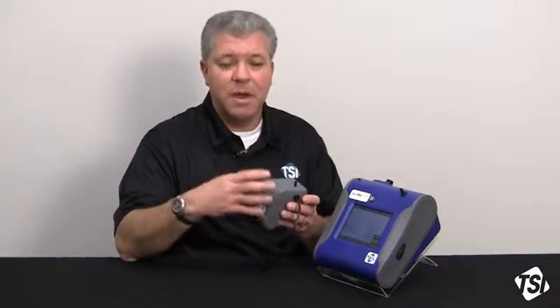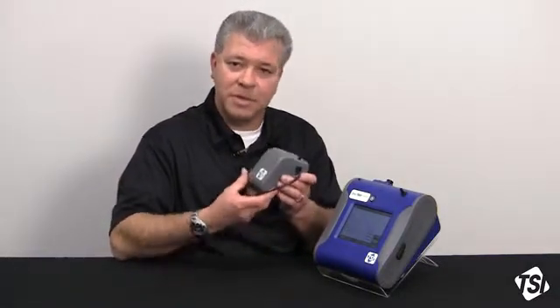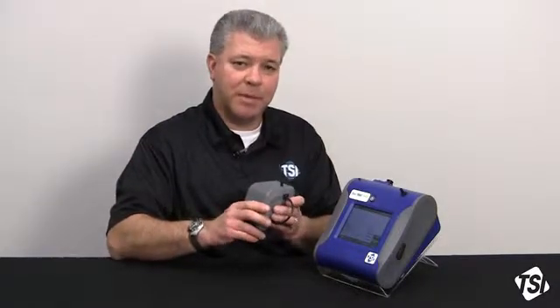Another reason would be temperature and humidity variations that can take place during the day, especially for outdoor environmental monitoring. It's cooler in the morning, humidity may be a little bit lower, temperatures rise during the day, and humidity may rise and or fall. And so you really want to be able to zero out those influences during your sampling period.